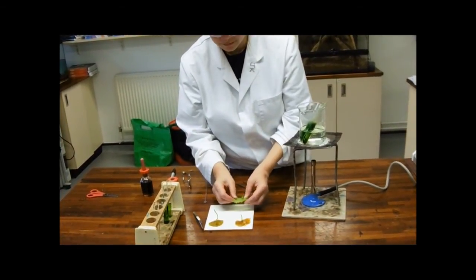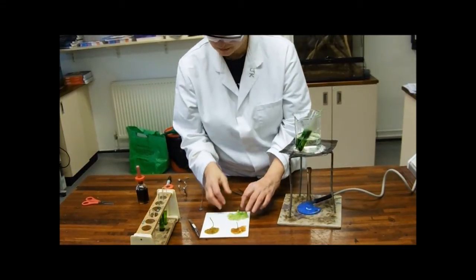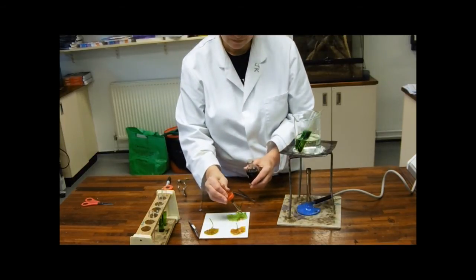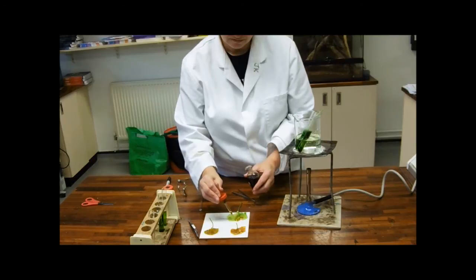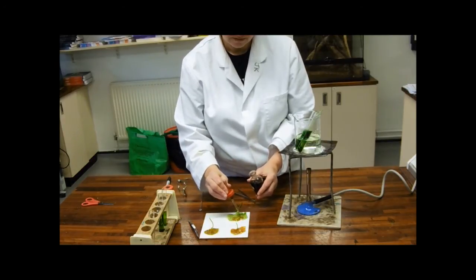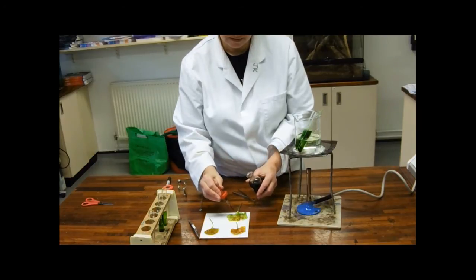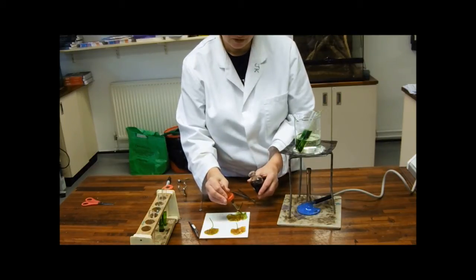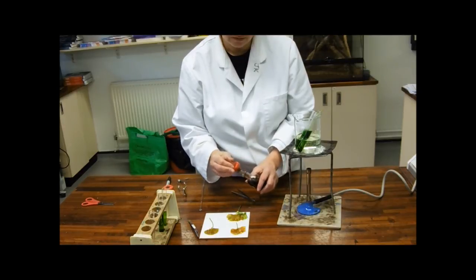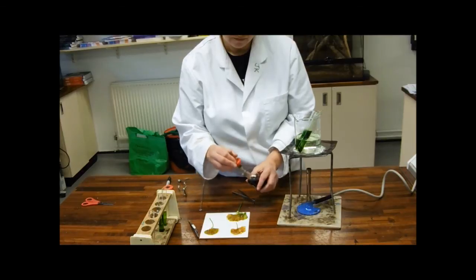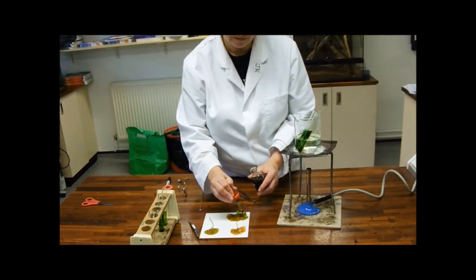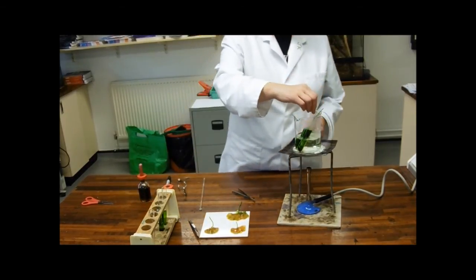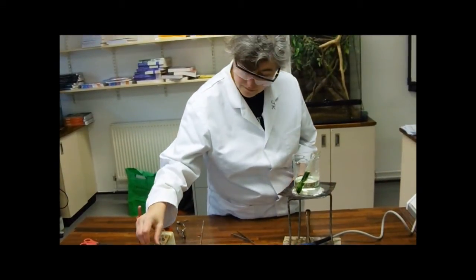I can't remember which one. Sorry, this one's been completely in the dark. Let me see, the chlorophyll, it's not come out particularly well. Again, I'm trying to do this properly now and not just tip it on. So again, not really expecting any color change here. And you see that although we've still got a bit of green, we could actually see if there was a color change. I'd like to say that variegated leaves are not terribly convincing. I'd like to change a little bit more green one, perhaps. Anyway. Such is life. That's the beauty of biology. Sometimes living things just don't do quite what you expect them to be.